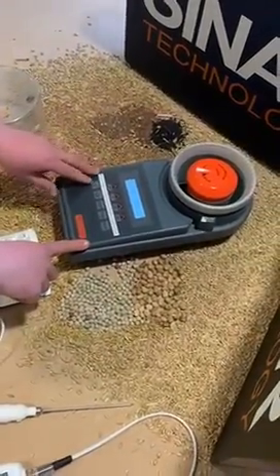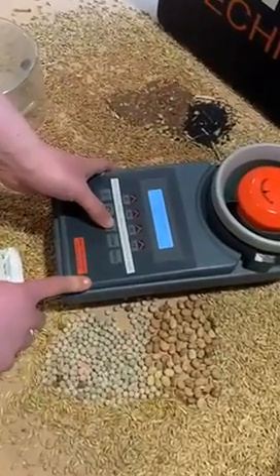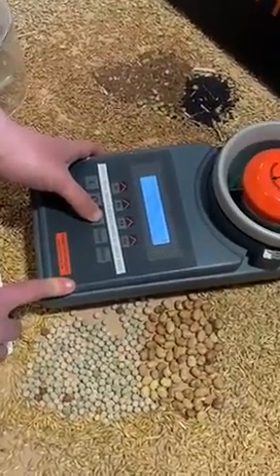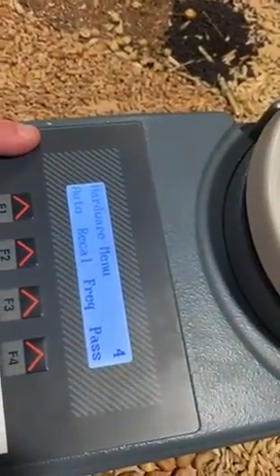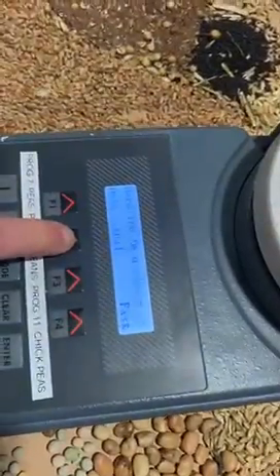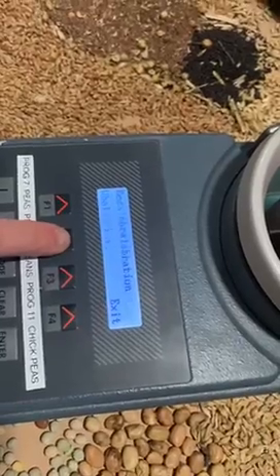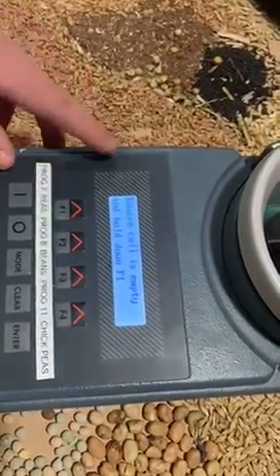Once past the password, continue pressing mode to cycle through until you have the hardware menu. Once on the hardware menu, press F2 for Recal, F2 again for Full, F1 for Continue and then hold down F1.